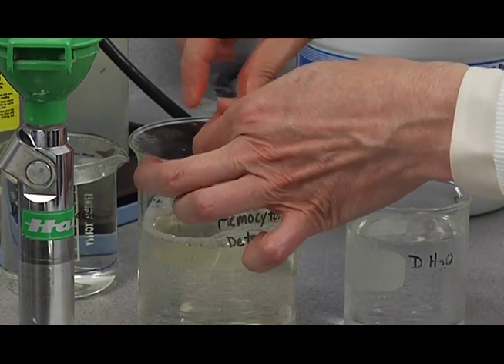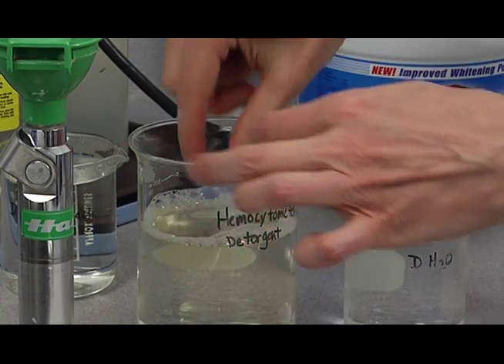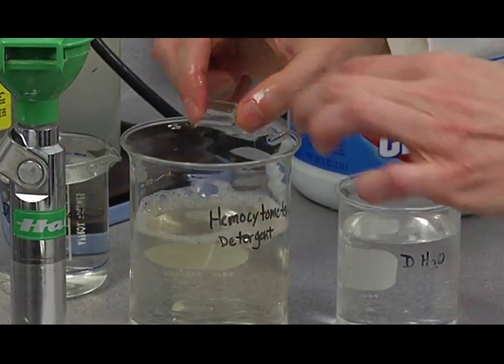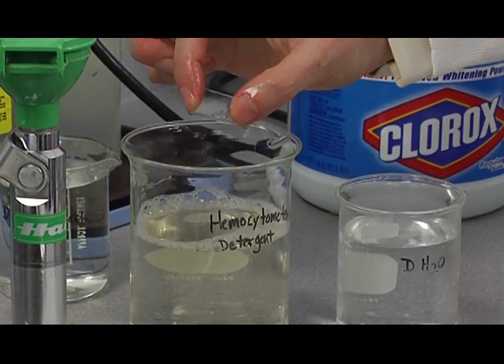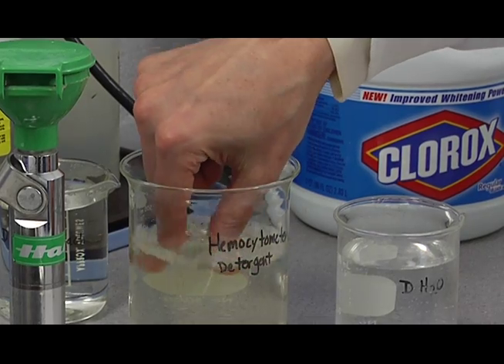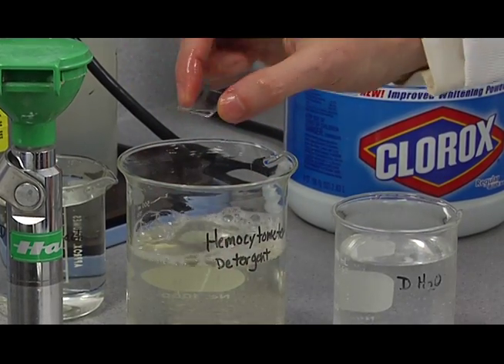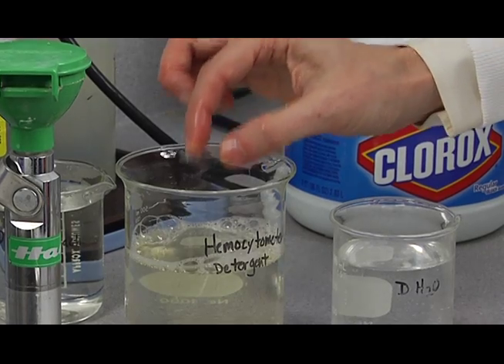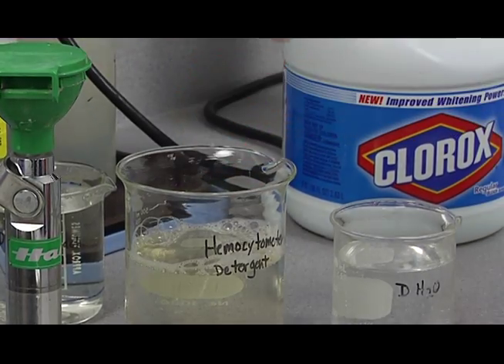It's just so critical to the success of your counts to have it really, really clean. And then you always want to hold it from these sides, just like this. And after you've scrubbed it the last time, you don't want to touch the surface again because you want to avoid oil droplets from your fingers.